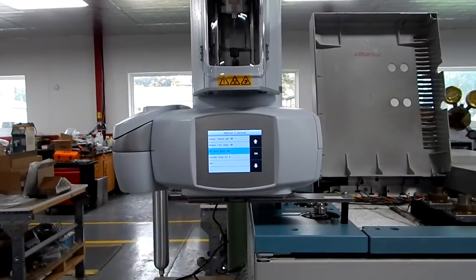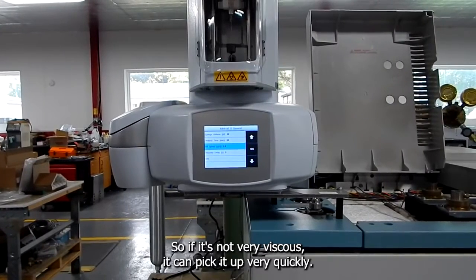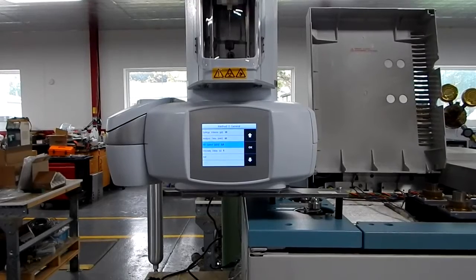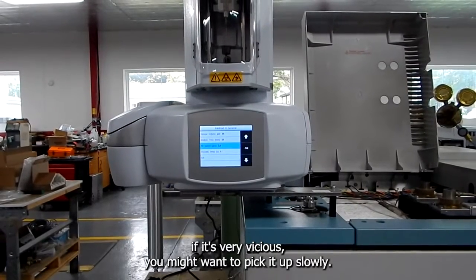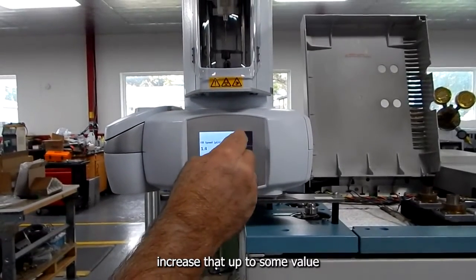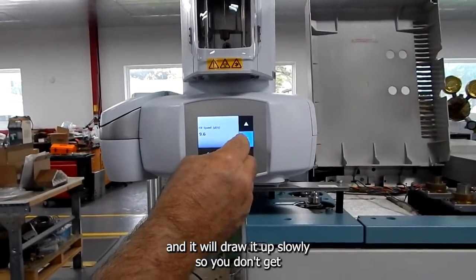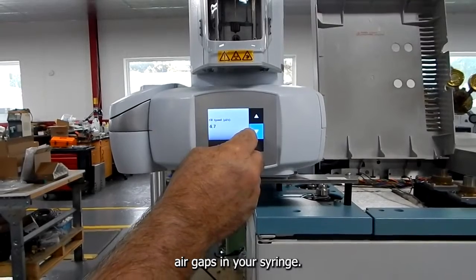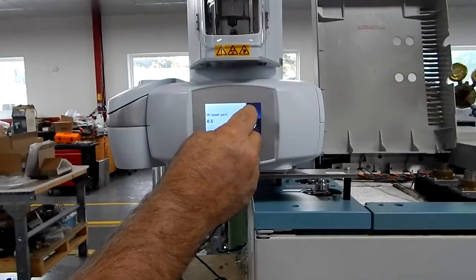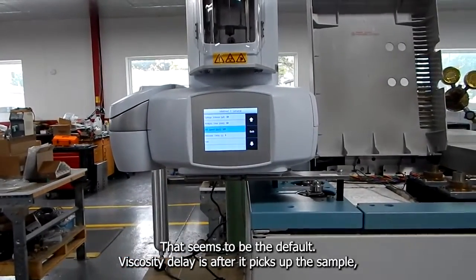Your fill speed would be dependent on the viscosity of your solvent in the sample. So if it's not very viscous, it can pick it up very quickly. But if it's very viscous, you might want to pick it up slowly. So you would want to then increase that up to some value. And it will draw it up slowly so you don't get air gaps in your syringe. And you can even go down from 0.1, I believe, probably up to 100. But we'll leave it at 1. That seems to be the default.